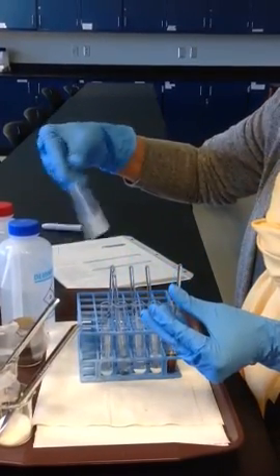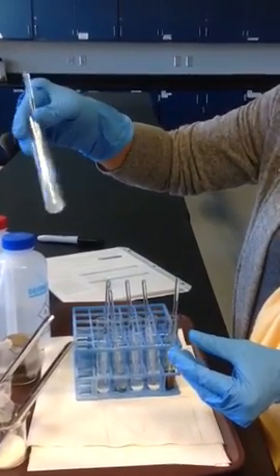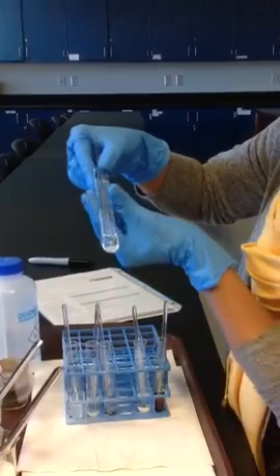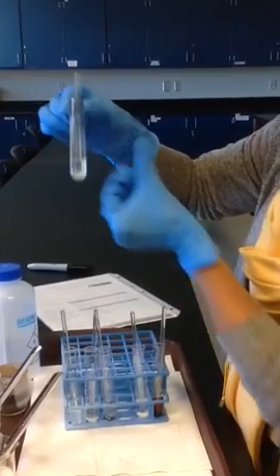And I can just stir it like this. And you can see that the salt has dissolved in water. And let's compare the salt in acetone, and notice you still see these crystals up here, so it hasn't dissolved.